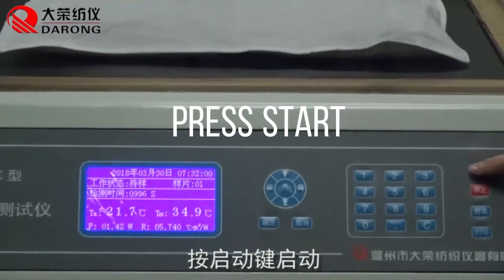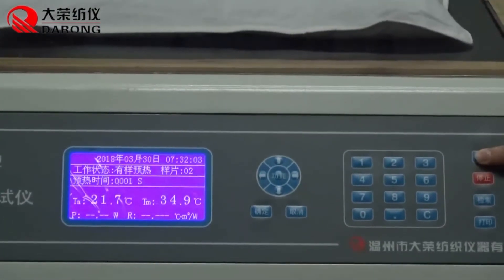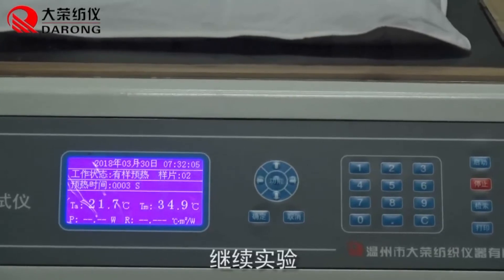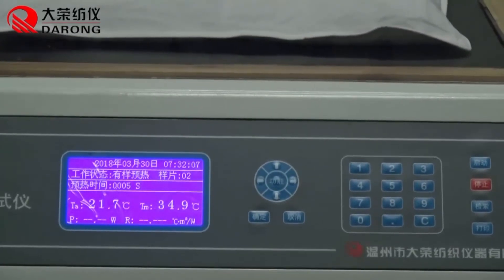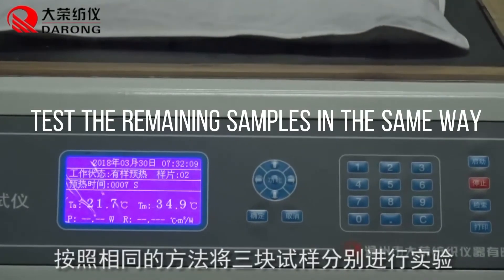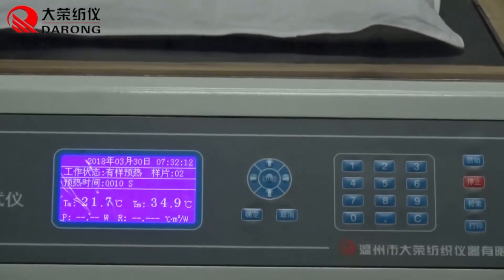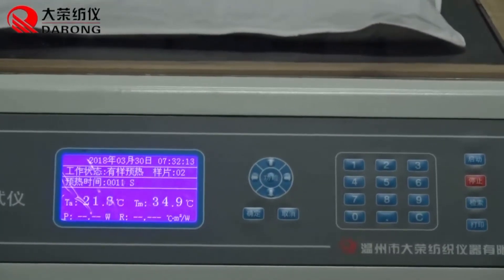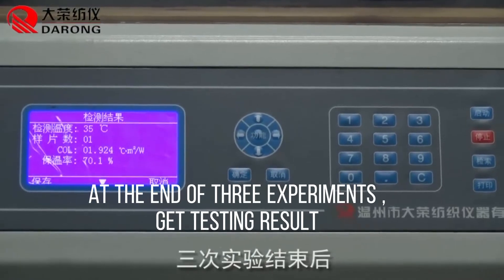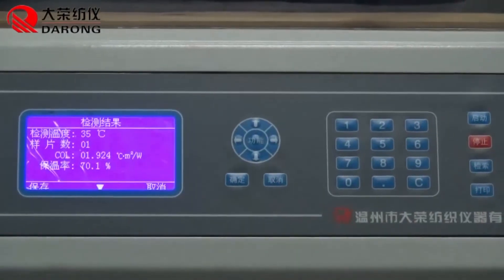Press start. Test the remaining samples in the same way. At the end of three experiments, get the testing results.